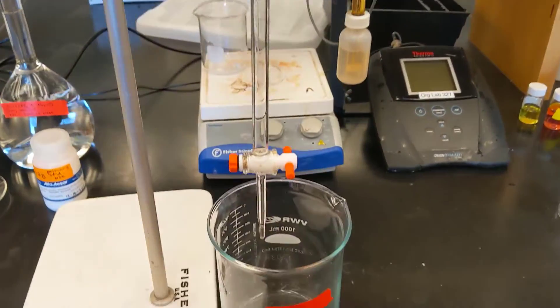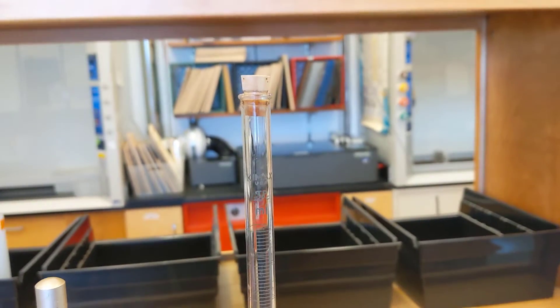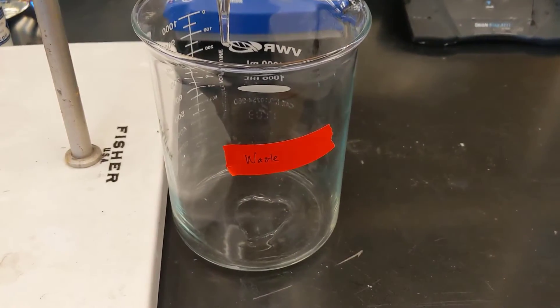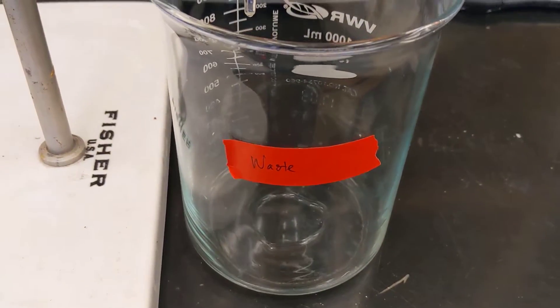So you're going to grab your burette. Notice the burette typically should have water filled in it at the end of its use and stored that way. I've just drained the water into a waste beaker. So this is just a one liter beaker labeled as waste.